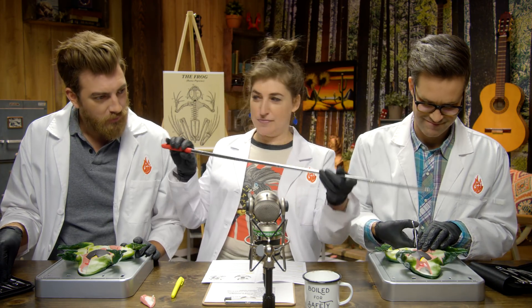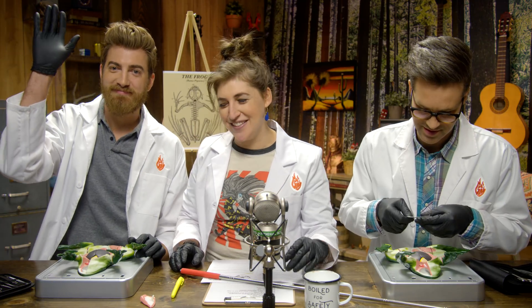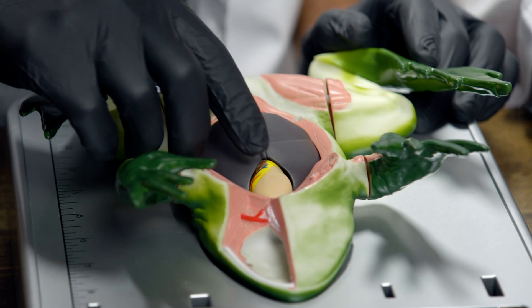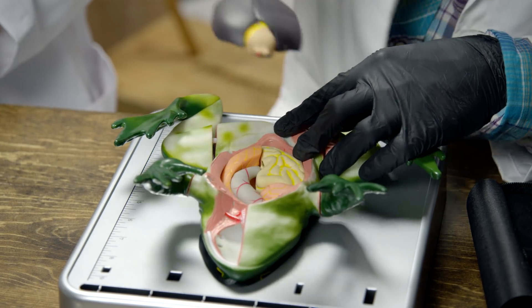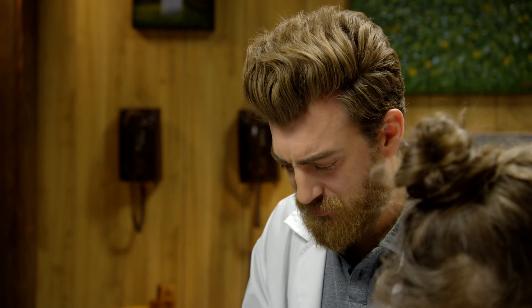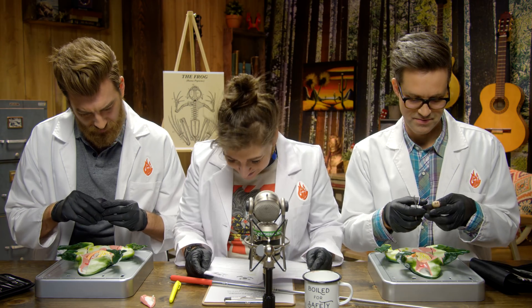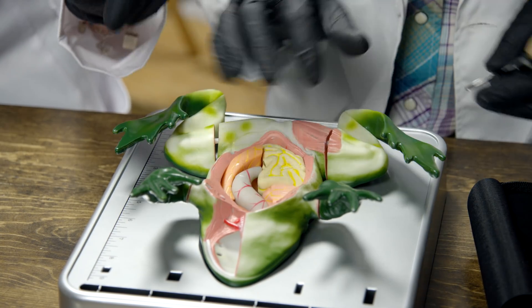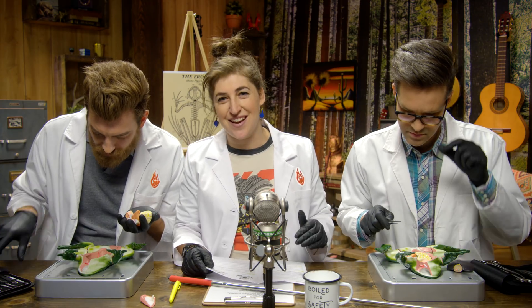What do you think is here at the top? That's a heart. That is the heart. I win. So you can take off the liver — I think this thing's got cirrhosis. Remove the licorice patch. The heart came off with it. Hold on — why do they gotta have such a big liver? These are the intestines obviously. Just like when you dissect a real frog, it looks nothing like the diagram.